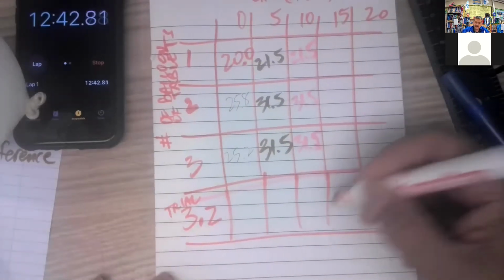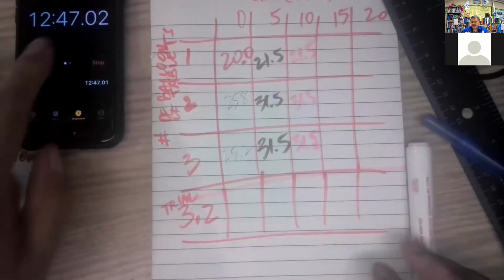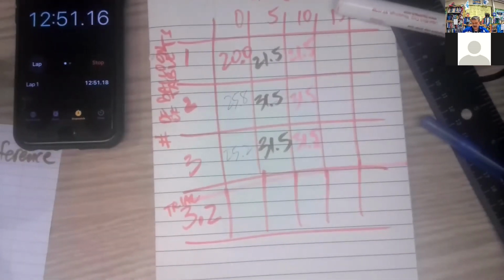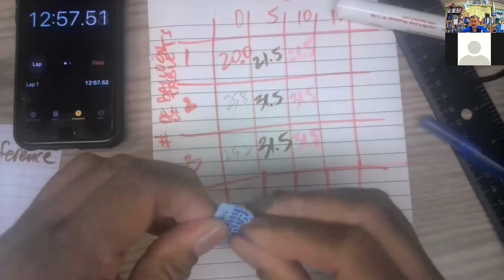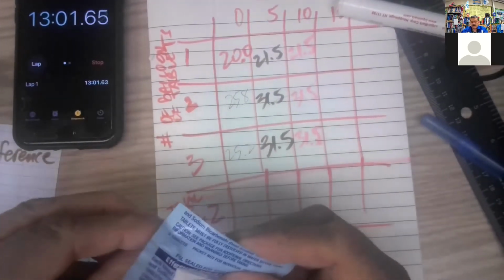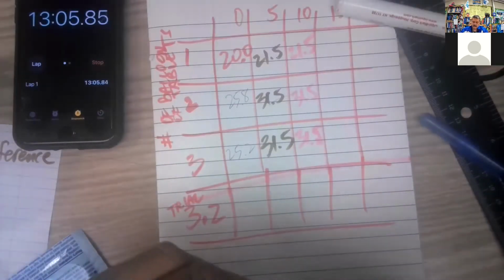So let me do that. And wind the clock over here. Check it again around 15. Take a couple more of these and crush them up. See what we get. I'll take that 1 out. 3 all together.